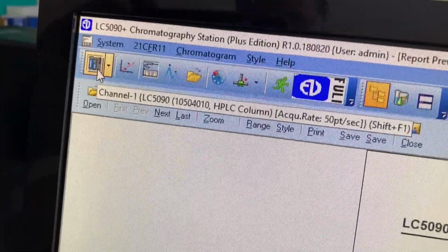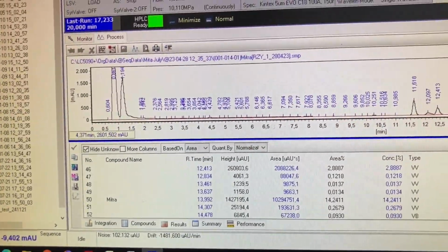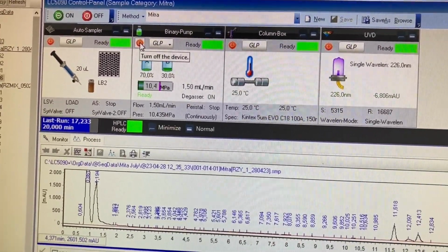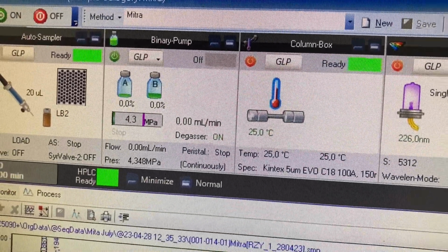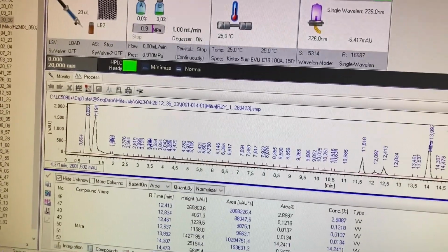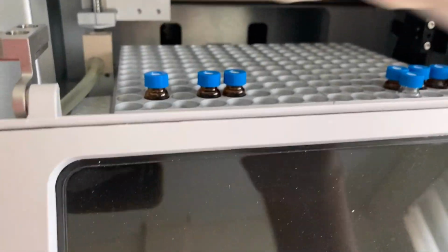If you want to go back, go to there, click, and then you're back onto it. And to save solvent, you can turn off the pump. So green is off. So now it's not running lots of solvent through. So you can get ready for the next test, or whatever you need to do, or just leave it running and then change the vial for the next test.